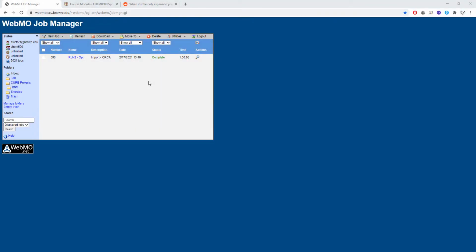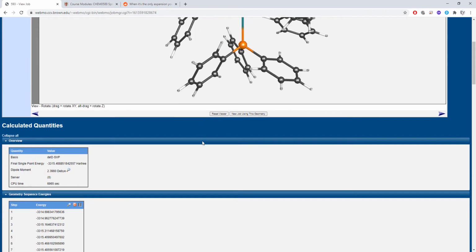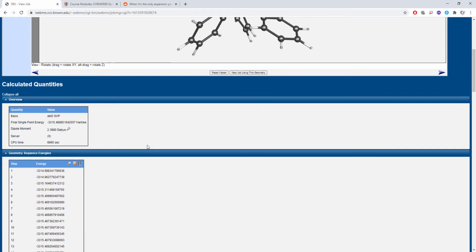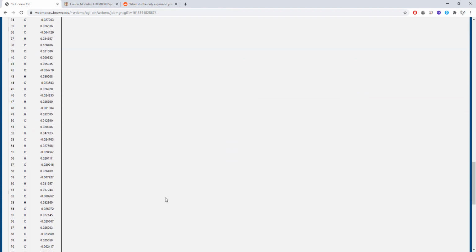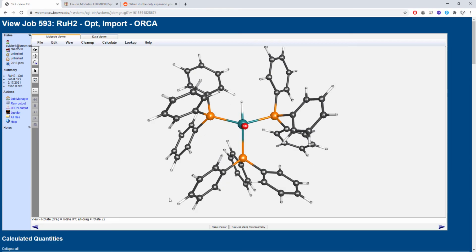So unfortunately, when the calculations get uploaded back into WebMO from the .out file, they don't include the molecular orbital information. If we go through, and I had uploaded my ruthenium calculation right here, and we scroll down, we see the information regarding the single point energy, the dipole moment, and so forth. We get the different steps from the calculation, and then we get our partial charges, but we don't get what the molecular orbitals look like.